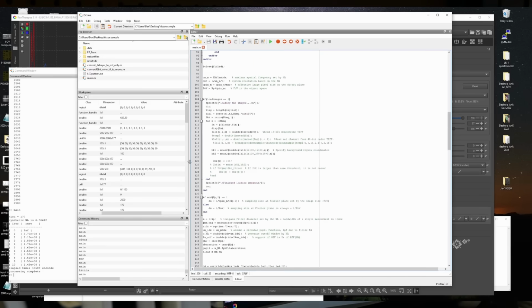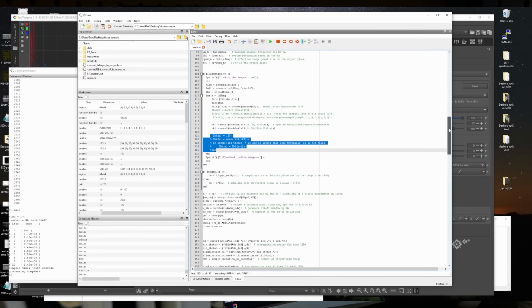There's also a small amount of code in here that attempts to subtract the background amount of signal from the image sensor. And I think this is because the image sensor that they were using is much rawer than even the raw from a consumer camera. So in other words, it backgrounds at several hundred counts, whereas a consumer camera really does get pretty close to 0, at least with the exposures that I was doing. So this part could actually be improved.